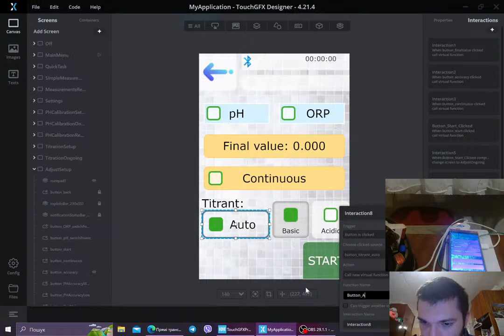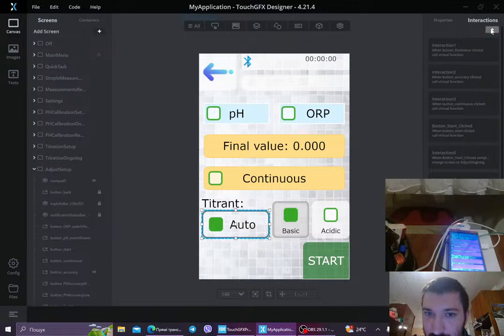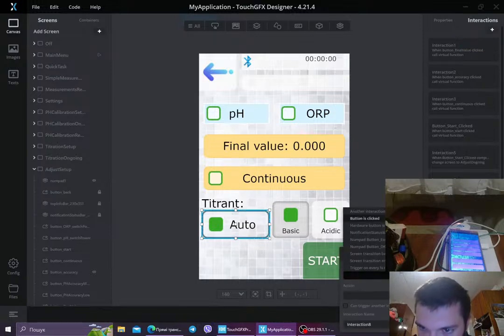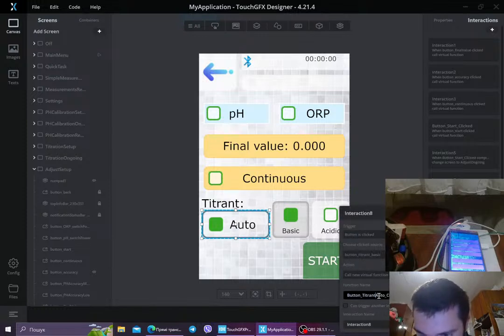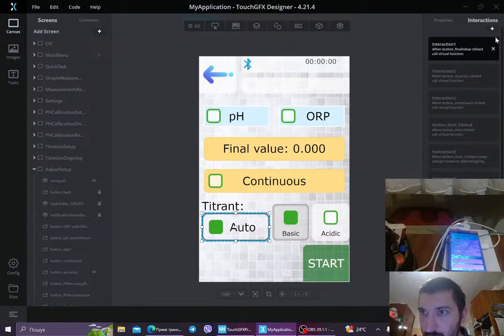button, auto, clicked, copied, placed. Okay, the next one is basic, button is clicked. Now we go to basic and call new function, titrator basic clicked, and no, I don't want to delete it.